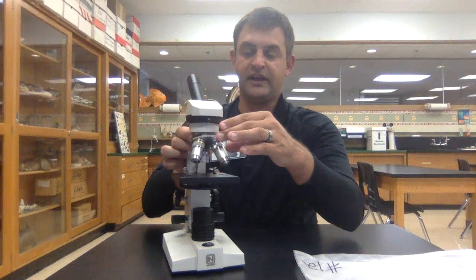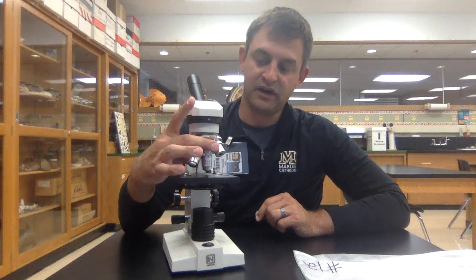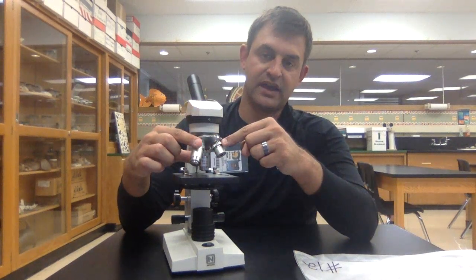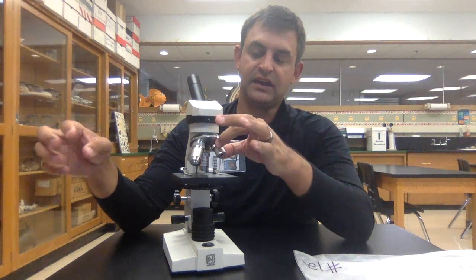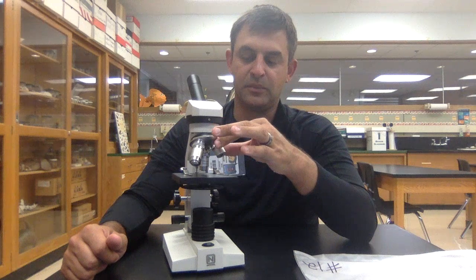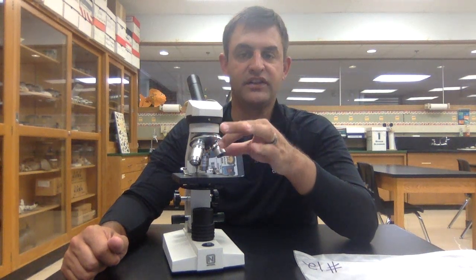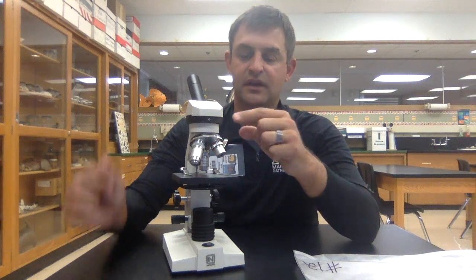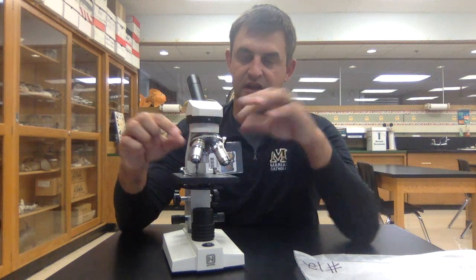Moving down from there, you've got our objective lenses. You'll notice there are three of them. The smallest lens is red — it has a red line all the way around it. It can magnify an object about four times, so it'll appear four times larger than it actually is. We call this our scanning lens. When you first put a specimen on the stage, that is the lens that you want to use.